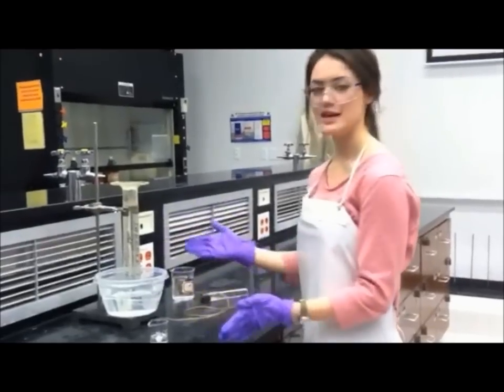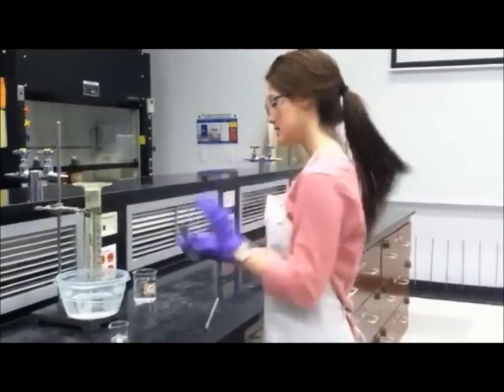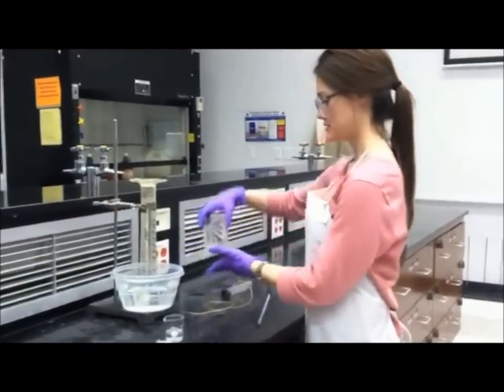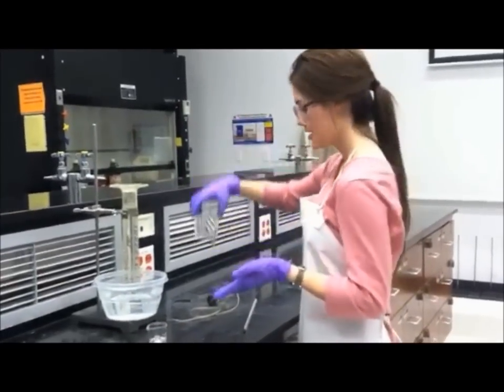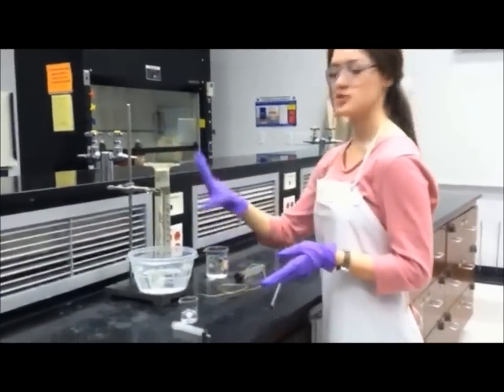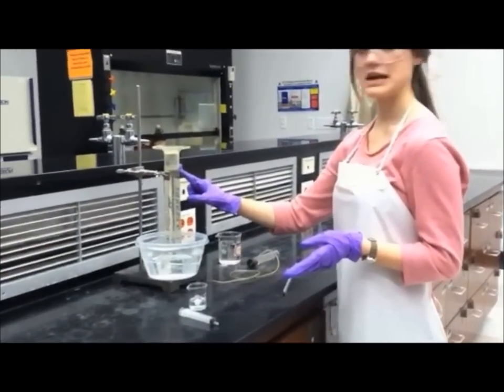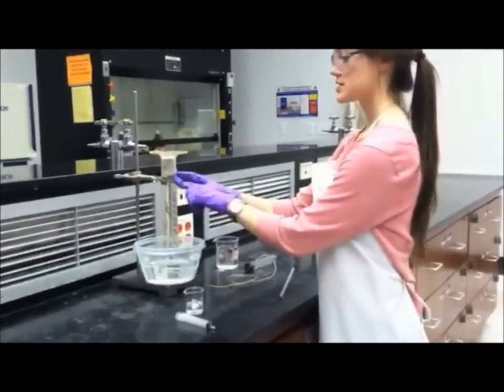This is what your final setup should look like. You should have your magnesium turnings from previously, and another smaller water bath that you'll need for the hydrochloric acid and magnesium turnings. And this is what we showed you earlier. And make sure you record right now before you forget the initial volume.